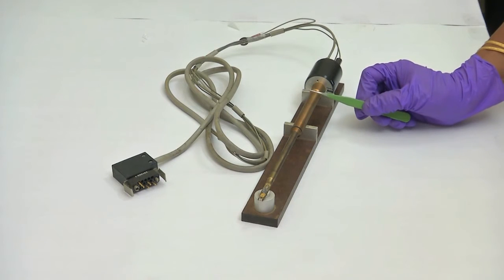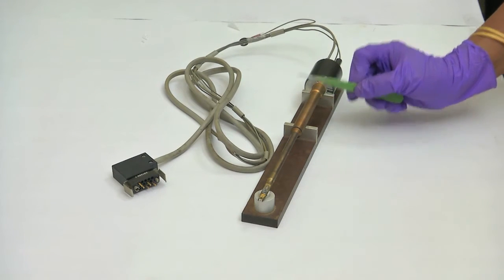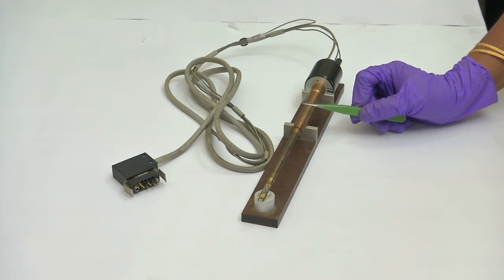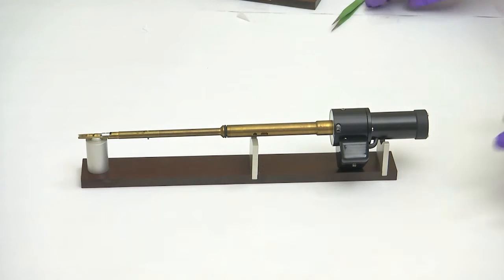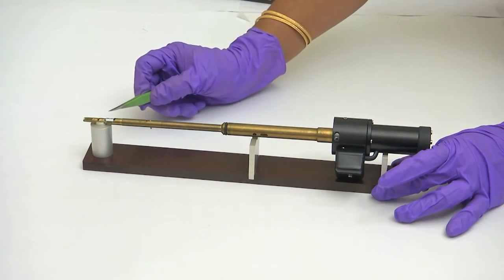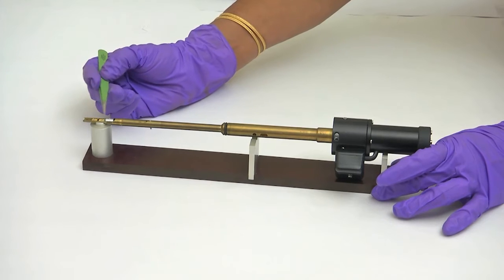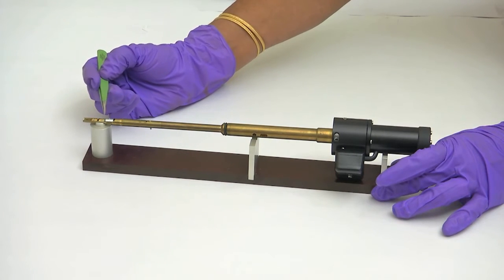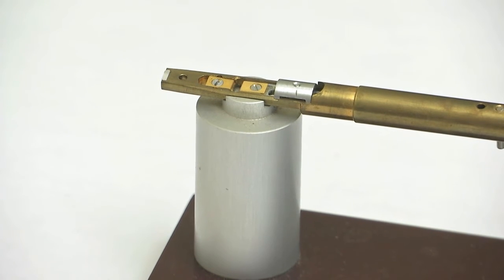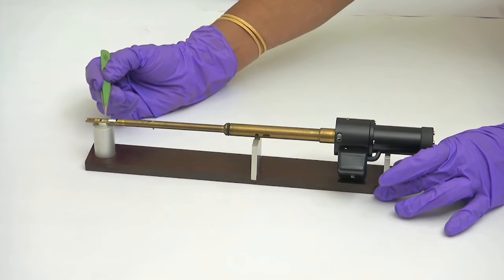This is a heating holder. By using this holder you can heat the specimen inside the microscope and continuously observe the effect of heat treatment. This is the straining holder — you can strain the sample inside the microscope while observing and see the effect of straining. There are 2 screws: you loosen the screws, put the specimen in, and proceed with the experiment.